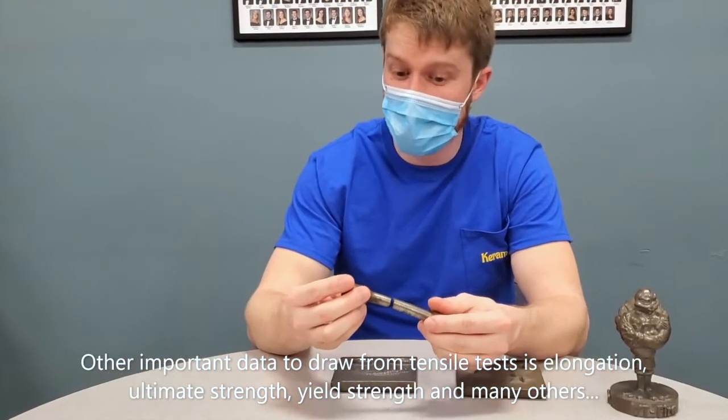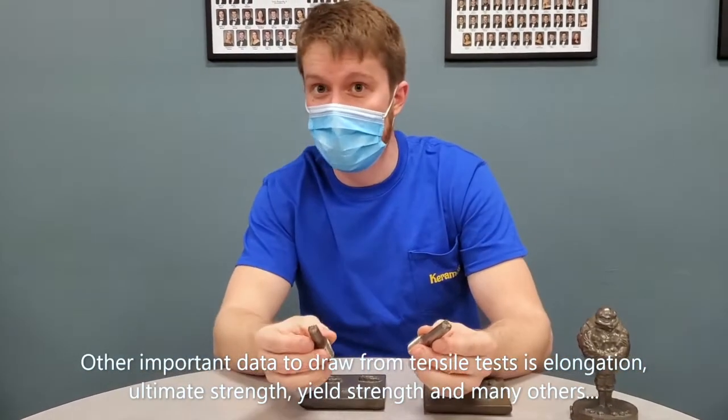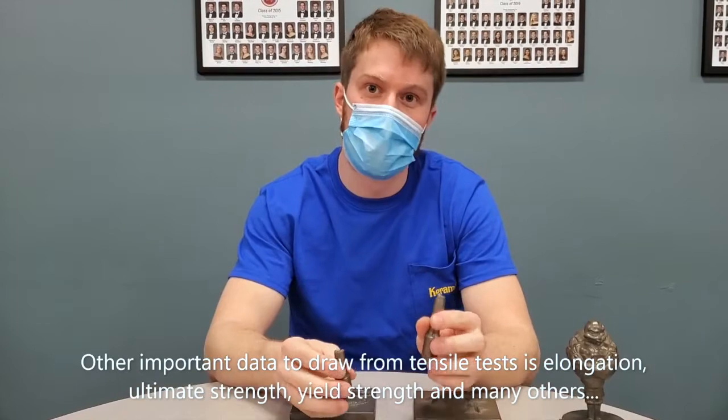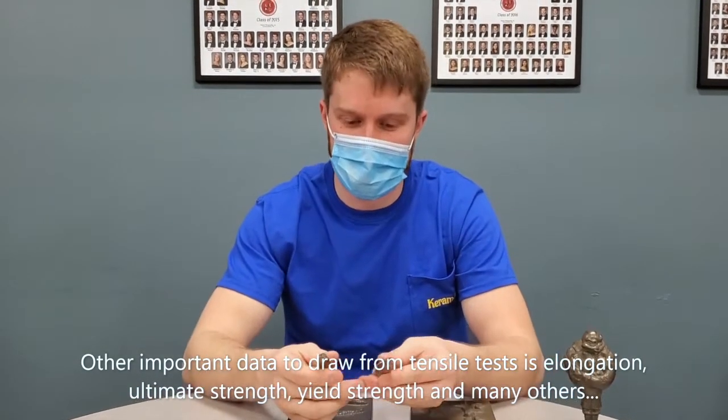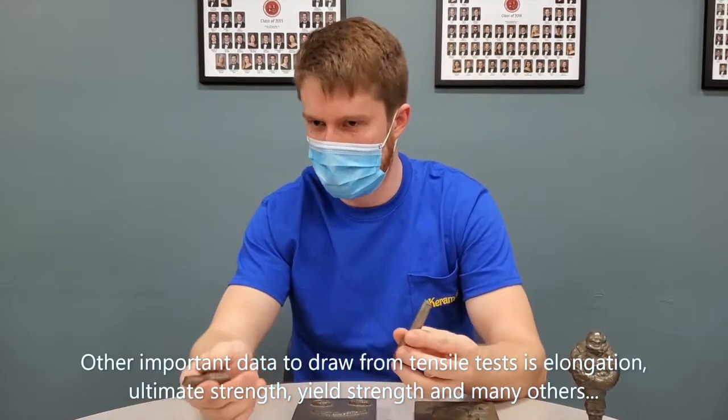This is very useful, and it is not only done for metals, but we also do this for polymers and different composites, just trying to test them in different loading conditions and see when and, more importantly, why they fail.